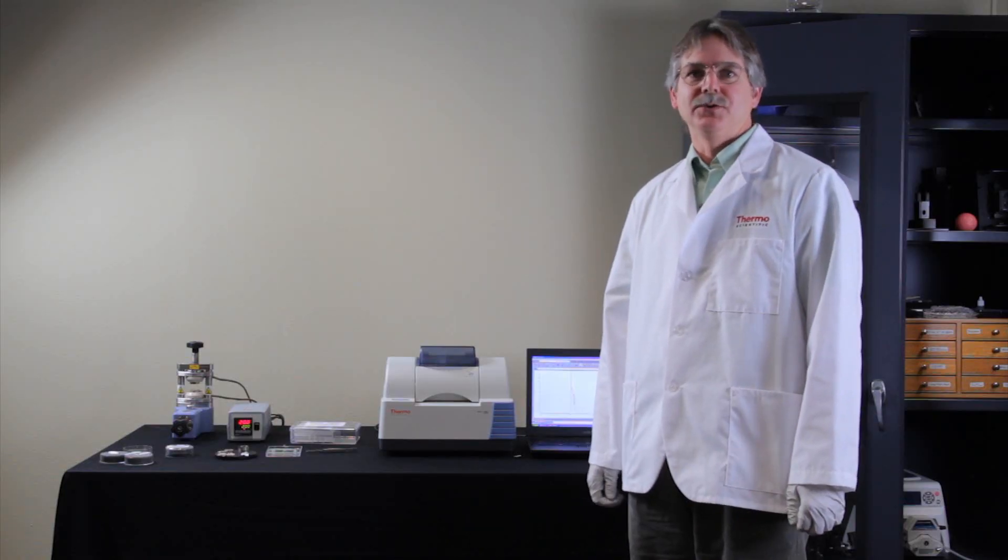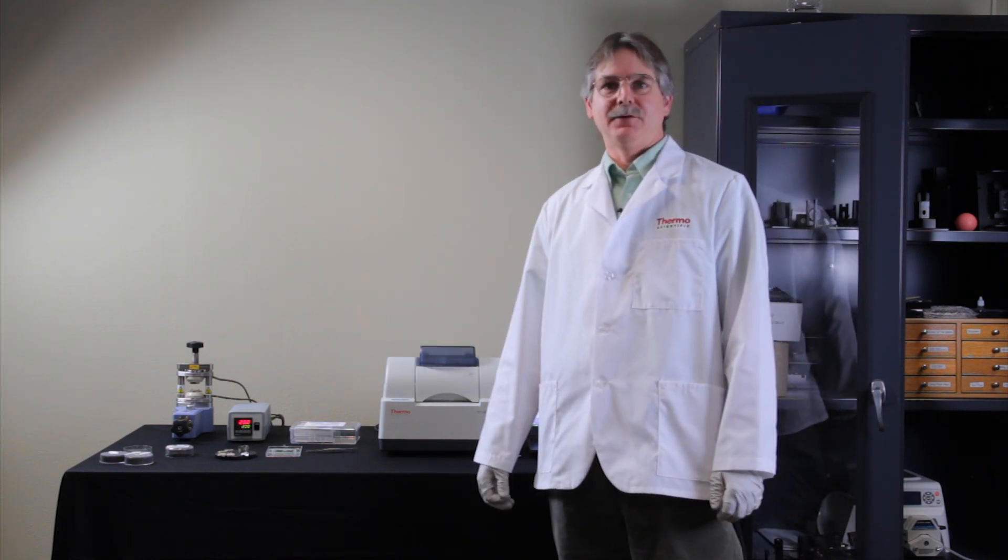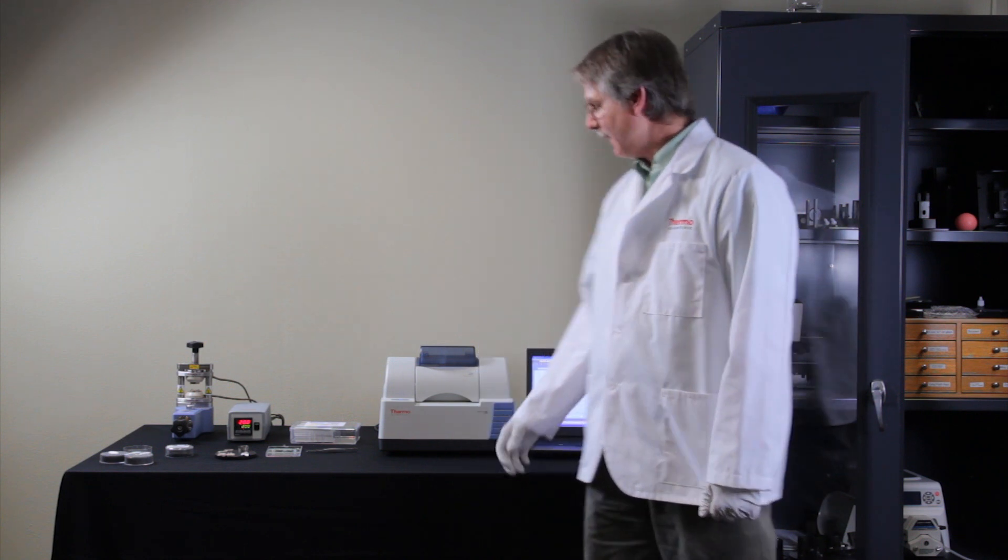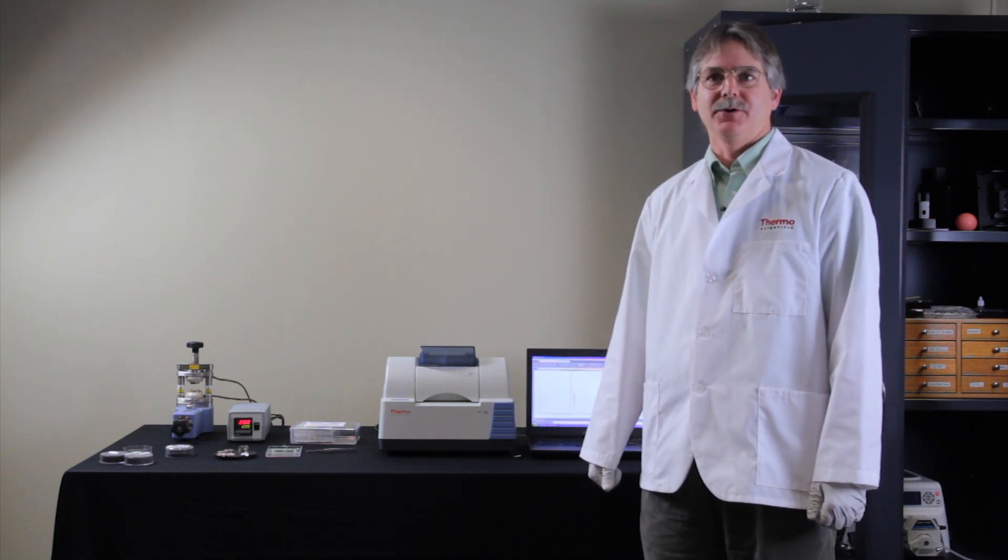And that's essentially all you need to do. So today's goals were to show you, demonstrate, how to make a film using our film press and analyze that film on our IS-5 spectrometer. Thank you.